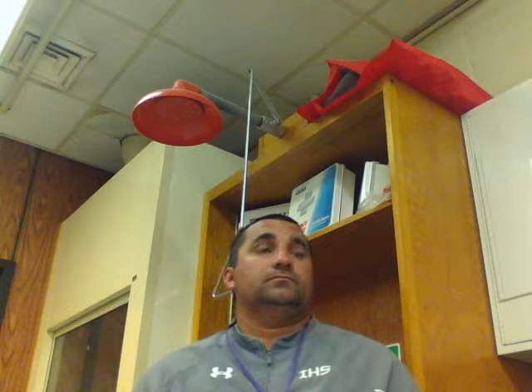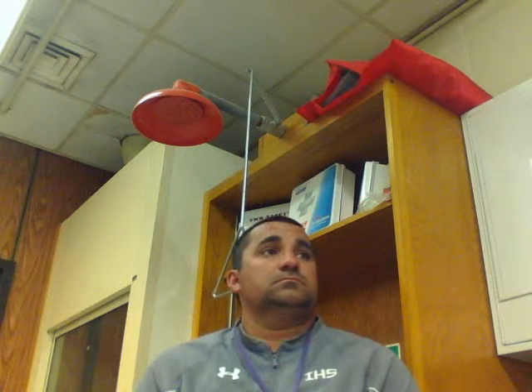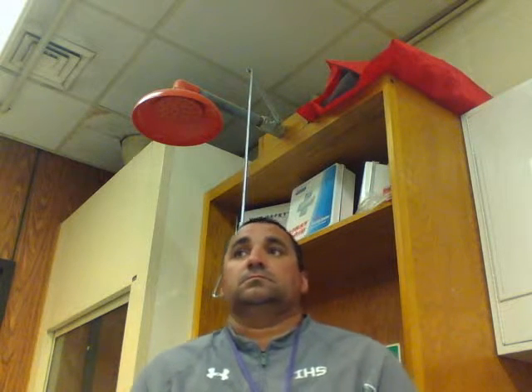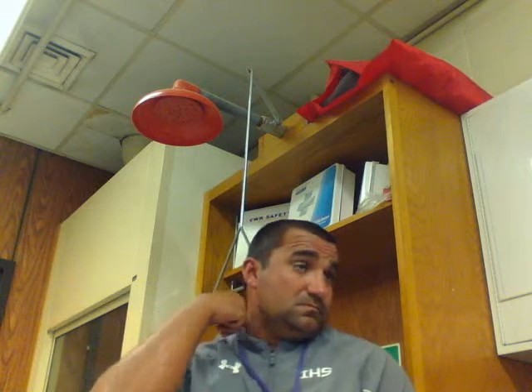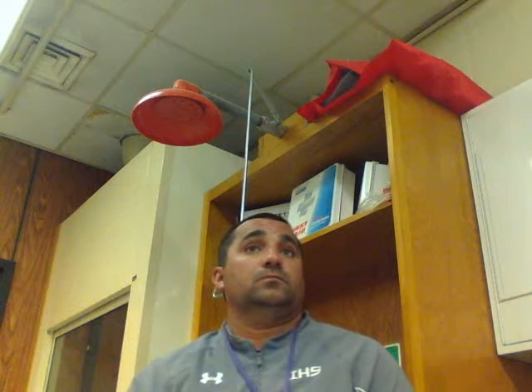Yeah, you just use the revolving motion. The scanning objective.